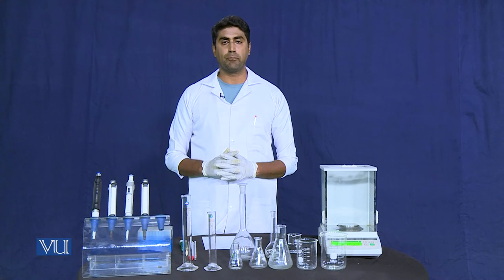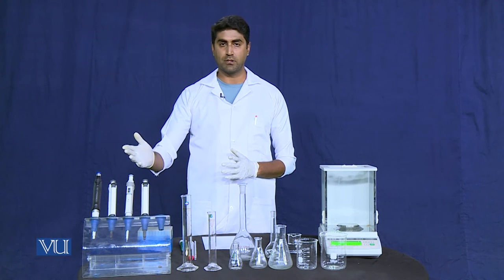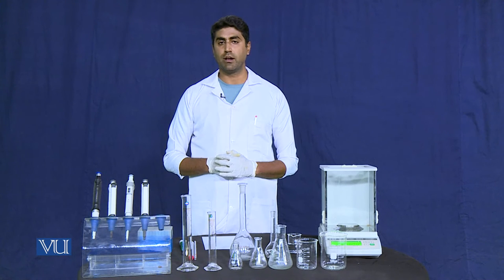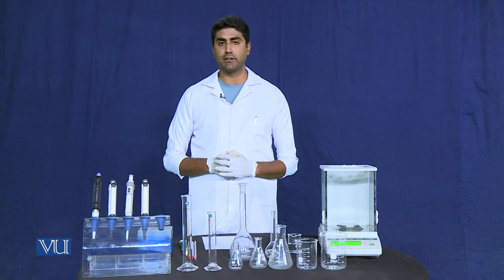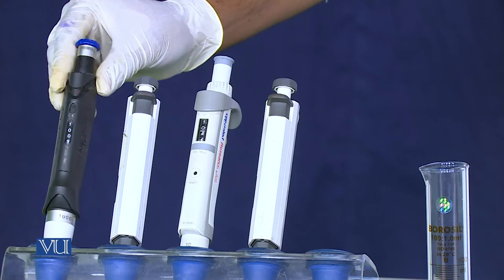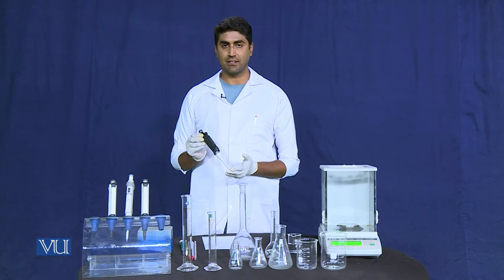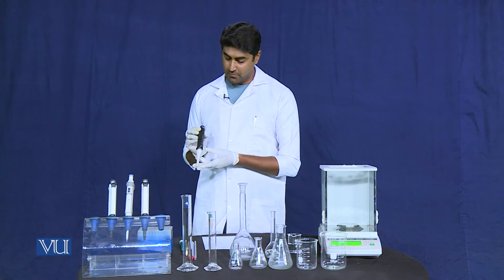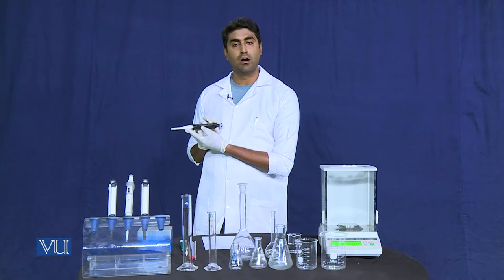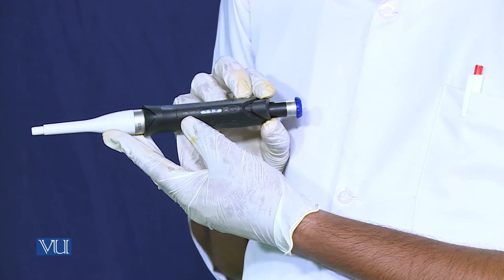The next lab equipment we have is the micropipette. If we want to measure the volume of liquid in microliters, we use the micropipette. It also comes in various volume capacities — like this micropipette, which can measure volume from 100 microliters to 1000 microliters.